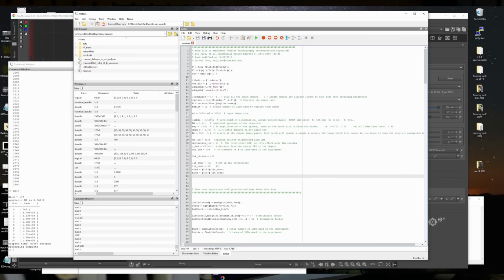The program must know about the optical setup with extreme detail. Obviously, it needs to know the wavelength of the light, it needs to know the dimensions of the image, it needs to know the numerical aperture of the objective that you're using, so it knows what the light cone is that the objective can capture. It needs to know the magnification of the setup, the size of the pixels on the image plane. This NP is basically how big of a reconstruction you want to make.